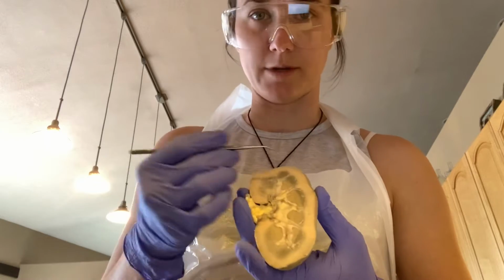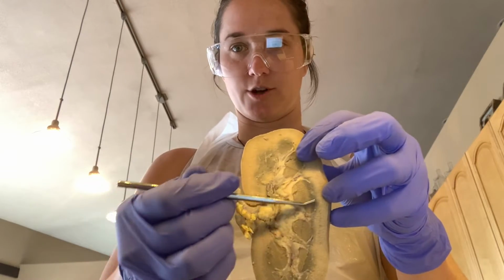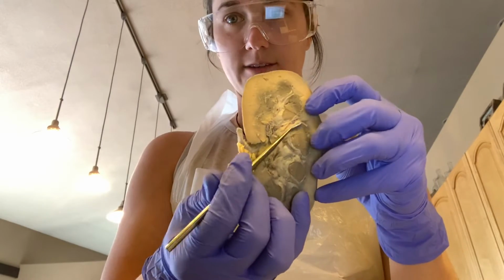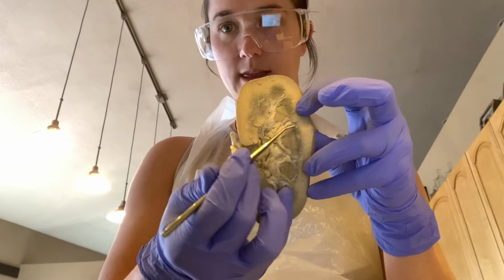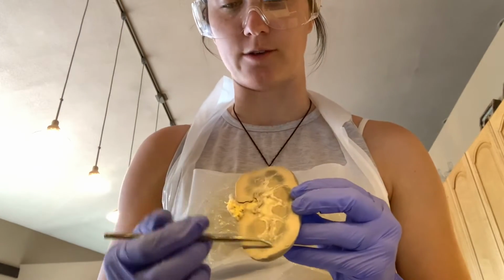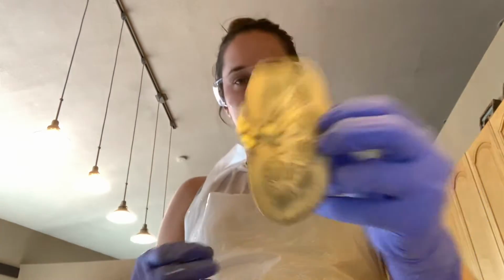Now, within the medulla, there are a few more structures I want to point out. One of those would be the renal pyramid. So these darker triangles here, you see those? The tips of these triangles, you can think of them pointing inward, so this would be the peak and this would be the base. And the base line is the renal cortex here. So those are the renal pyramids. And then in between the renal pyramids, we have the renal columns, and they separate out the renal pyramids, and there are many of them, as you can see here.